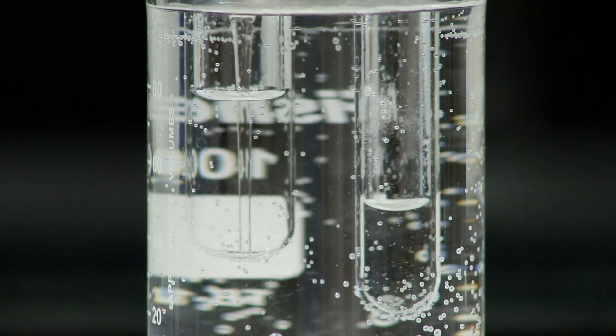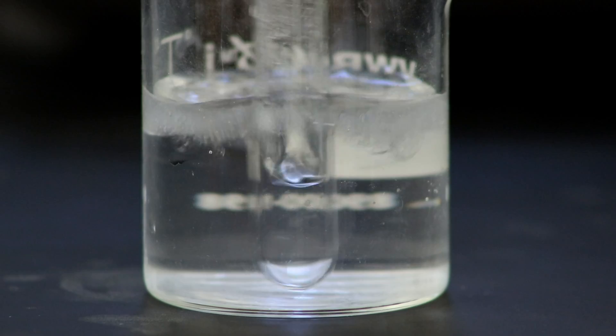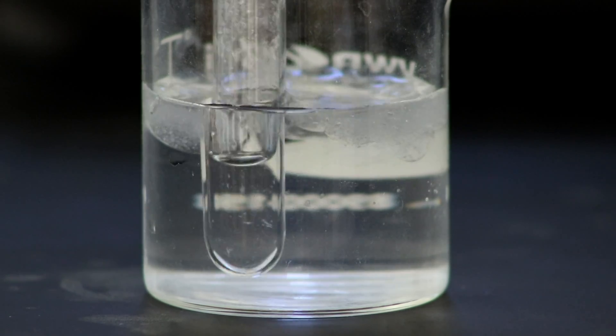Once it is completely dissolved I'll transfer it to an ice bath to make sure that the solid product can come out of solution.